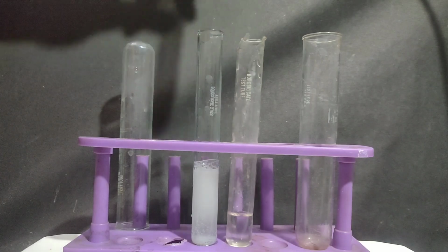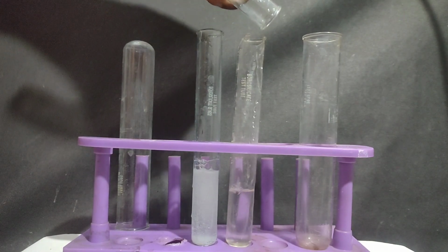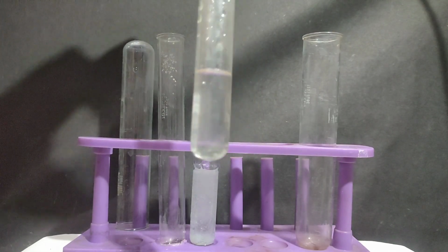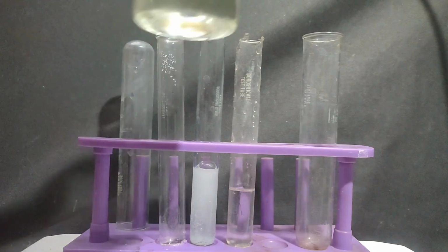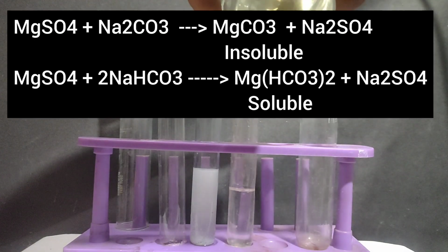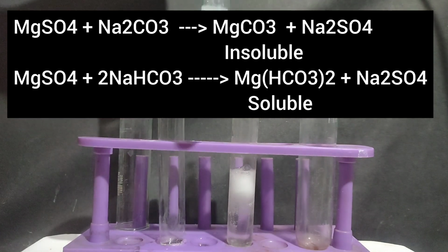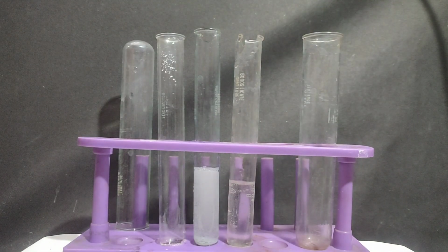But on adding the same solution into the bicarbonate one, see, there is no formation of precipitate in case of bicarbonate. But when we add dilute hydrochloric acid, effervescence is evolved.